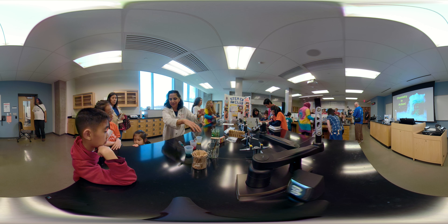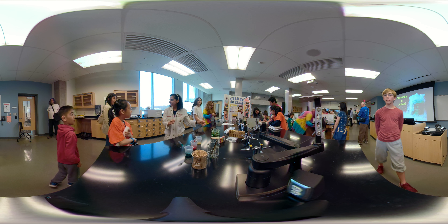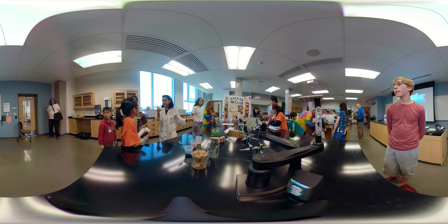This is just plain water. This is salt solution. If you want to come online, I'll show you the blue. Shall we do this, and then do the elephant toothpaste? Yeah.